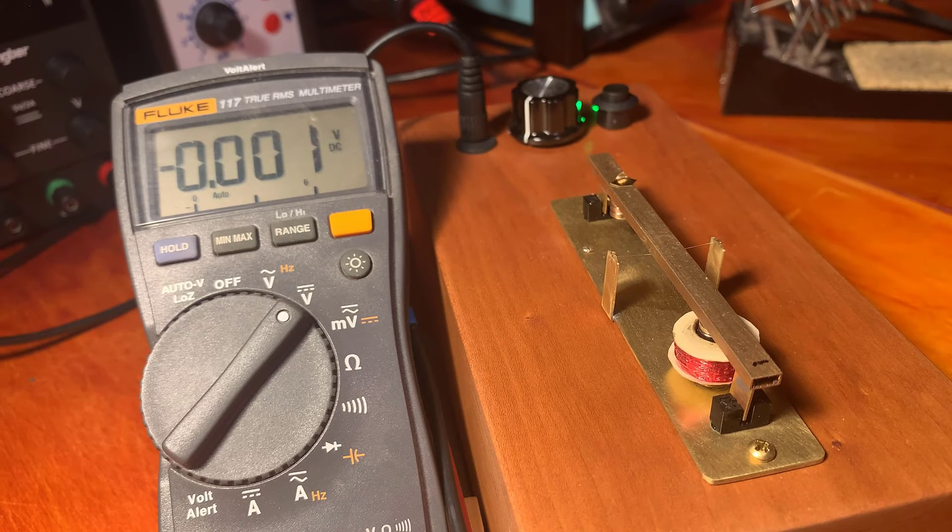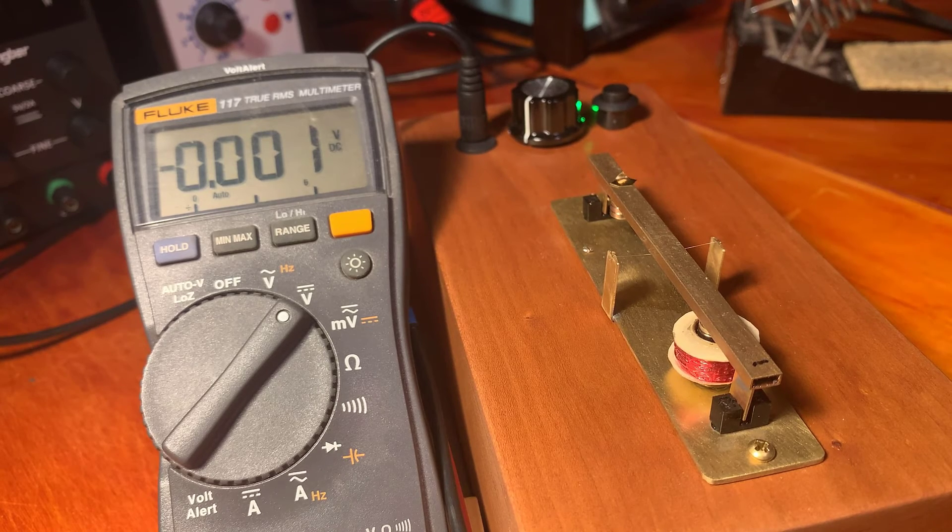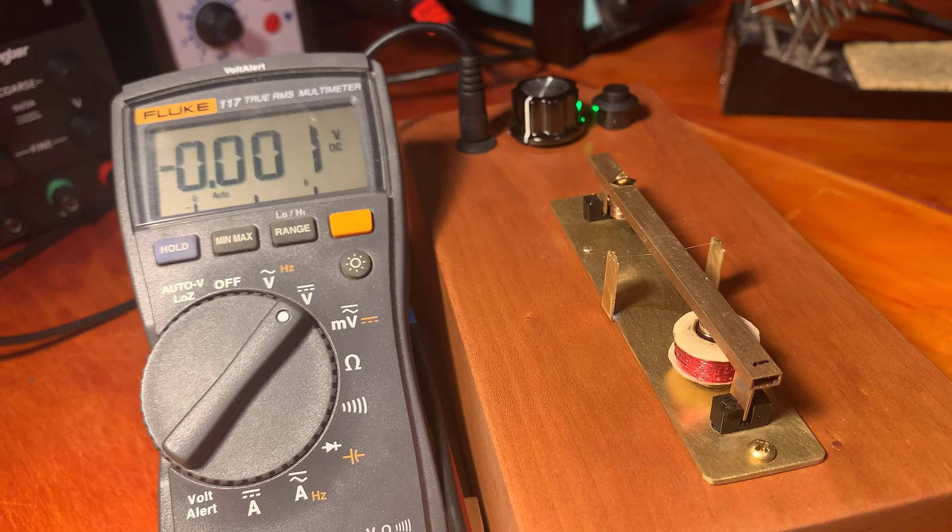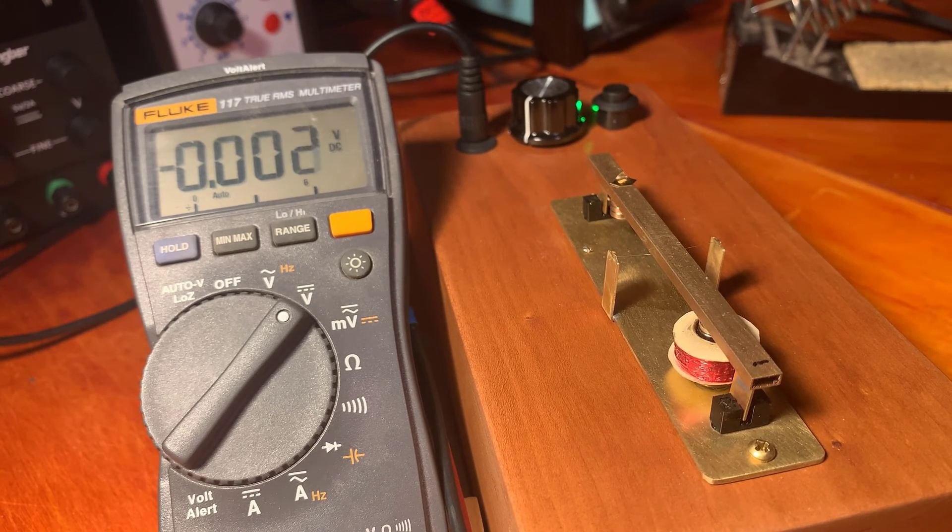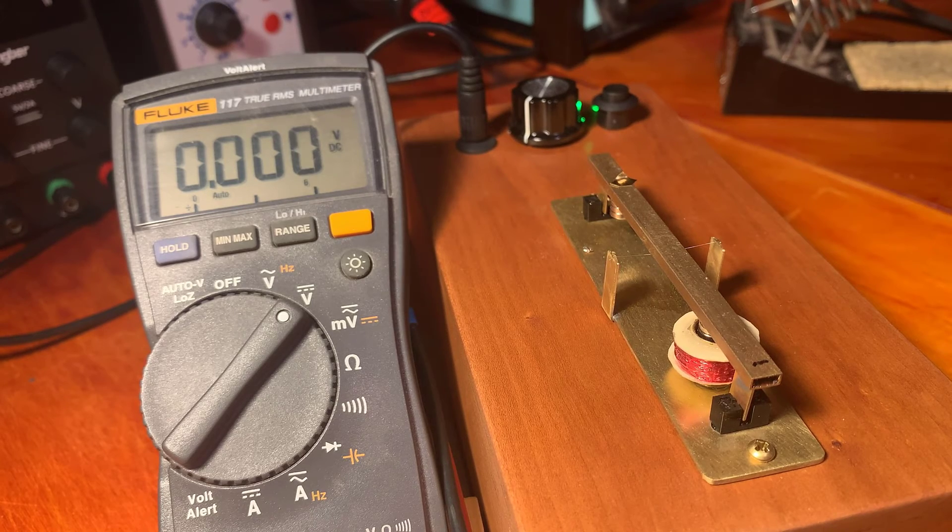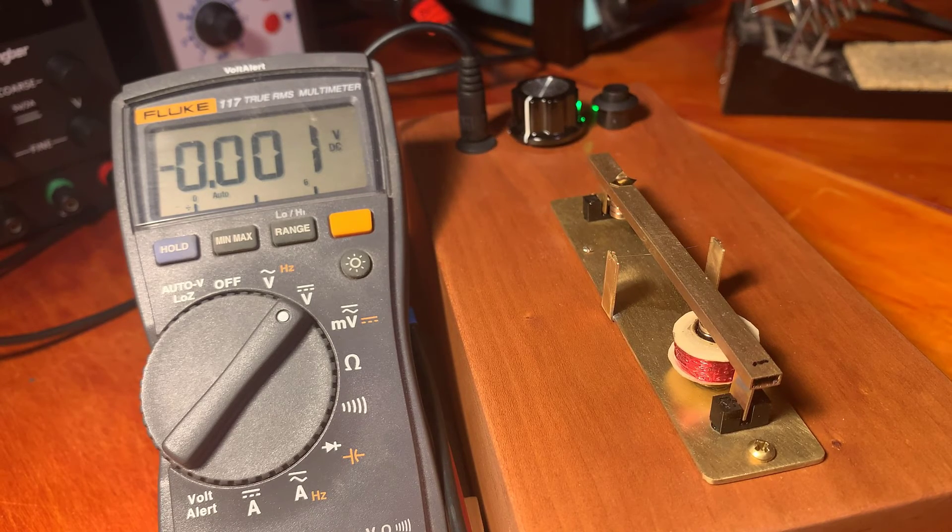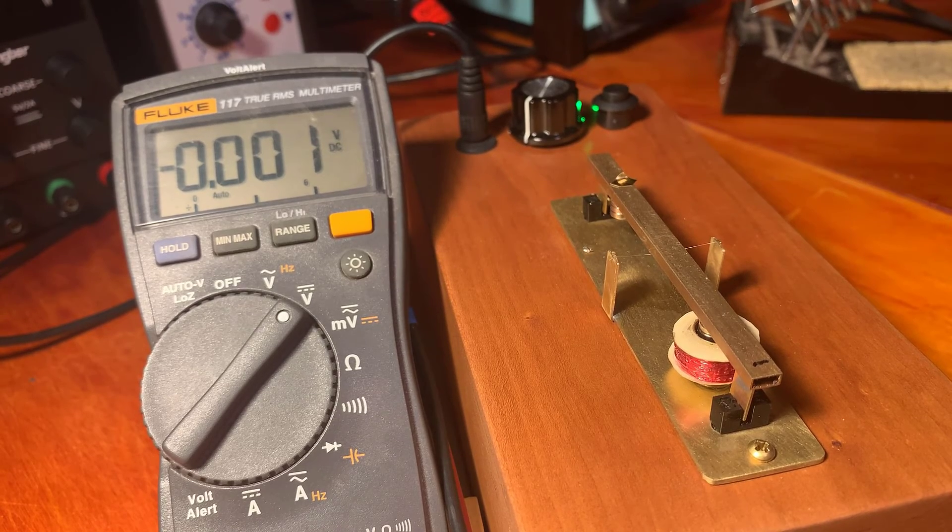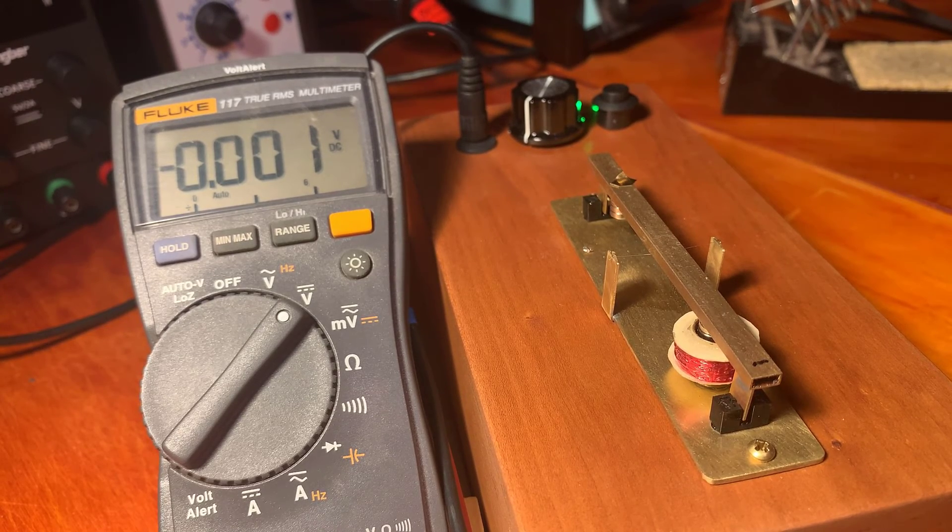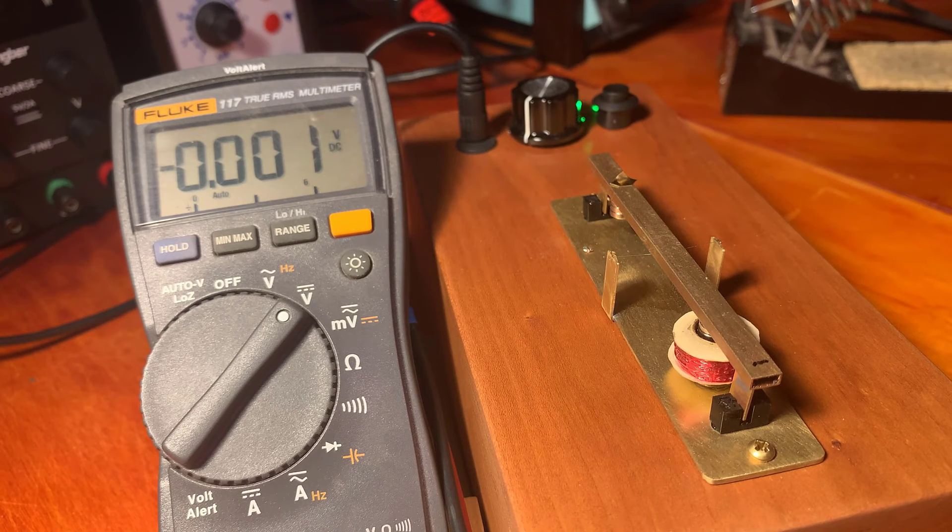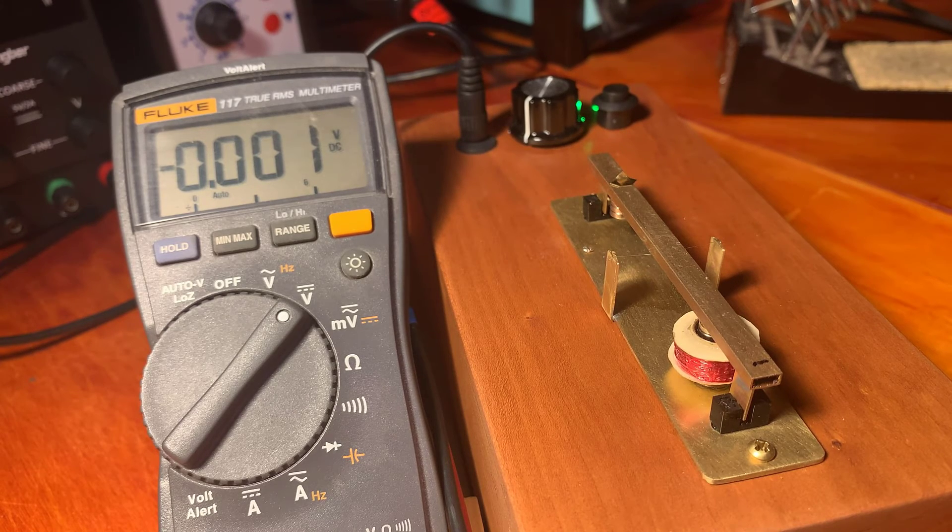Well, I have more. And luckily this experiment was not important anyway. Nonetheless, this is a very disturbing part of the problem. It's how you get these tiny gold beads onto the scale.